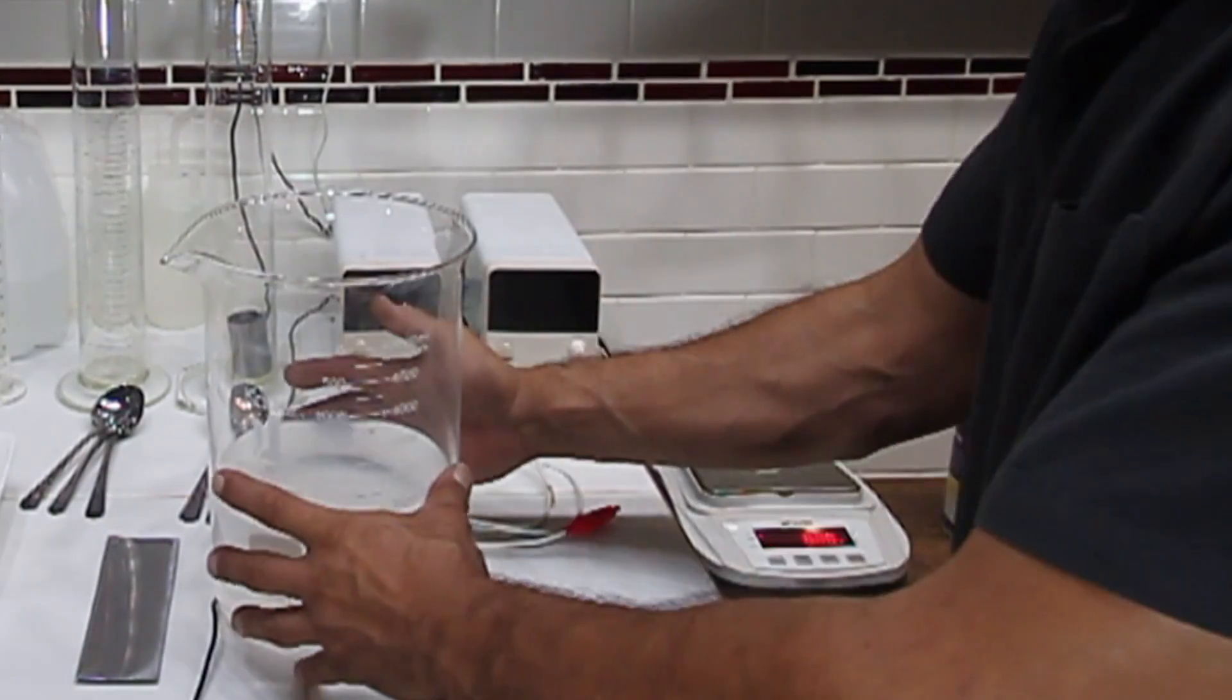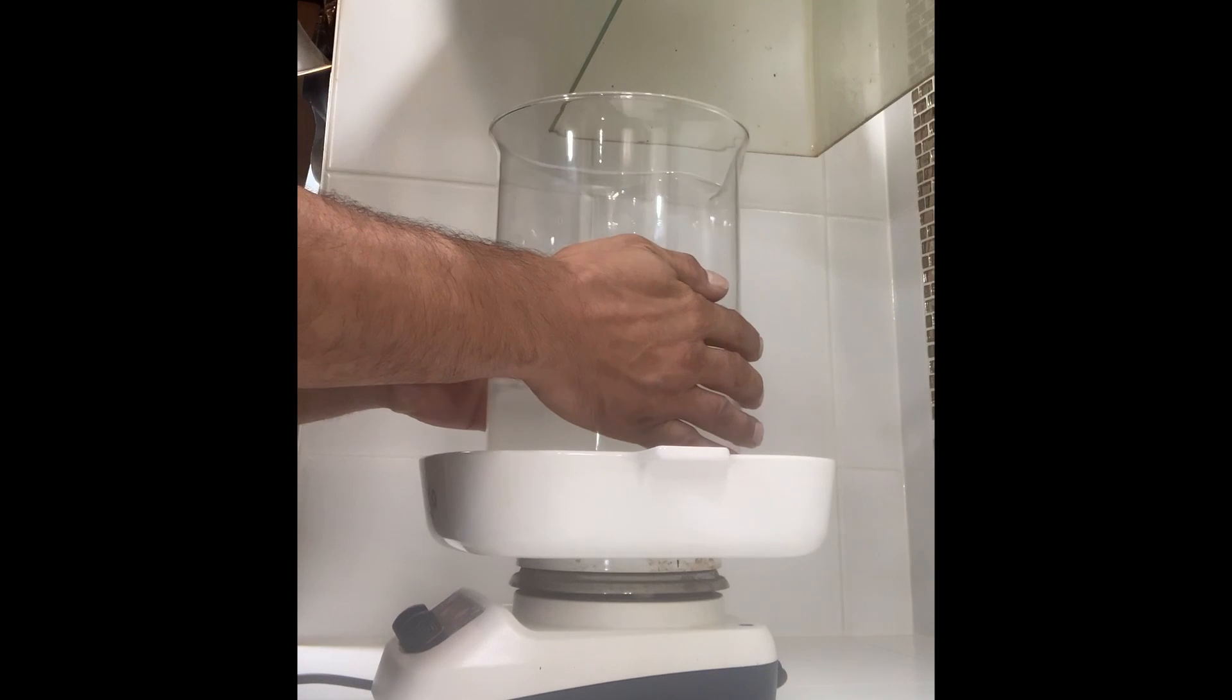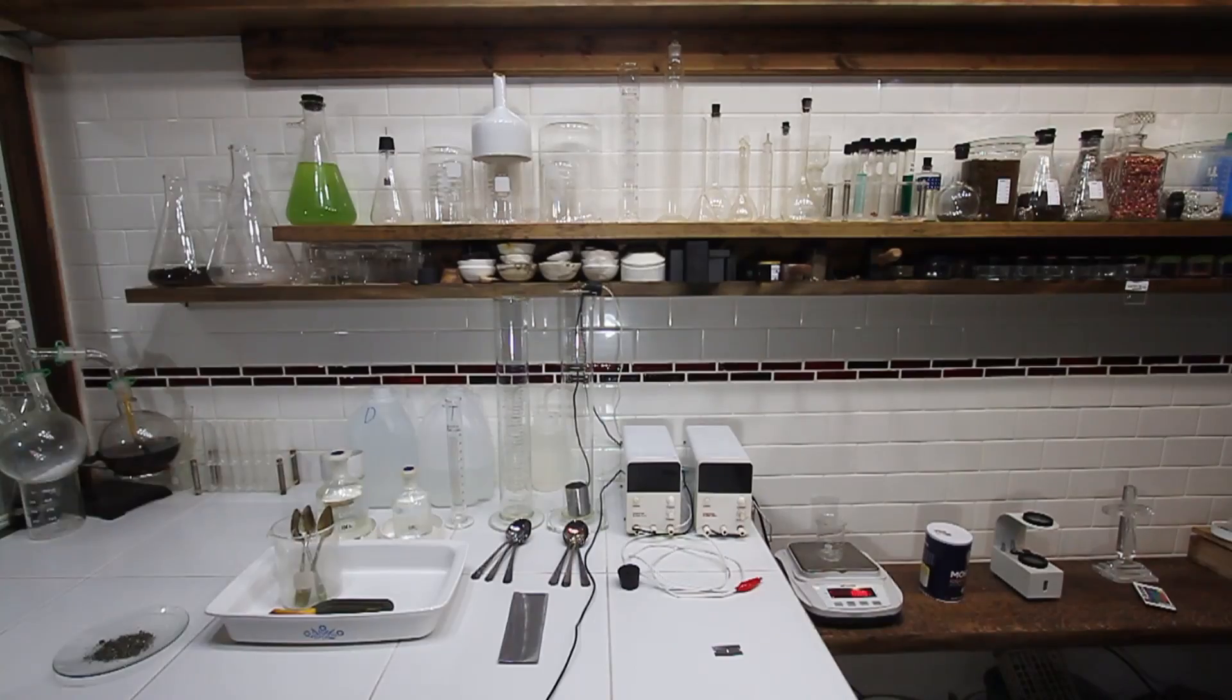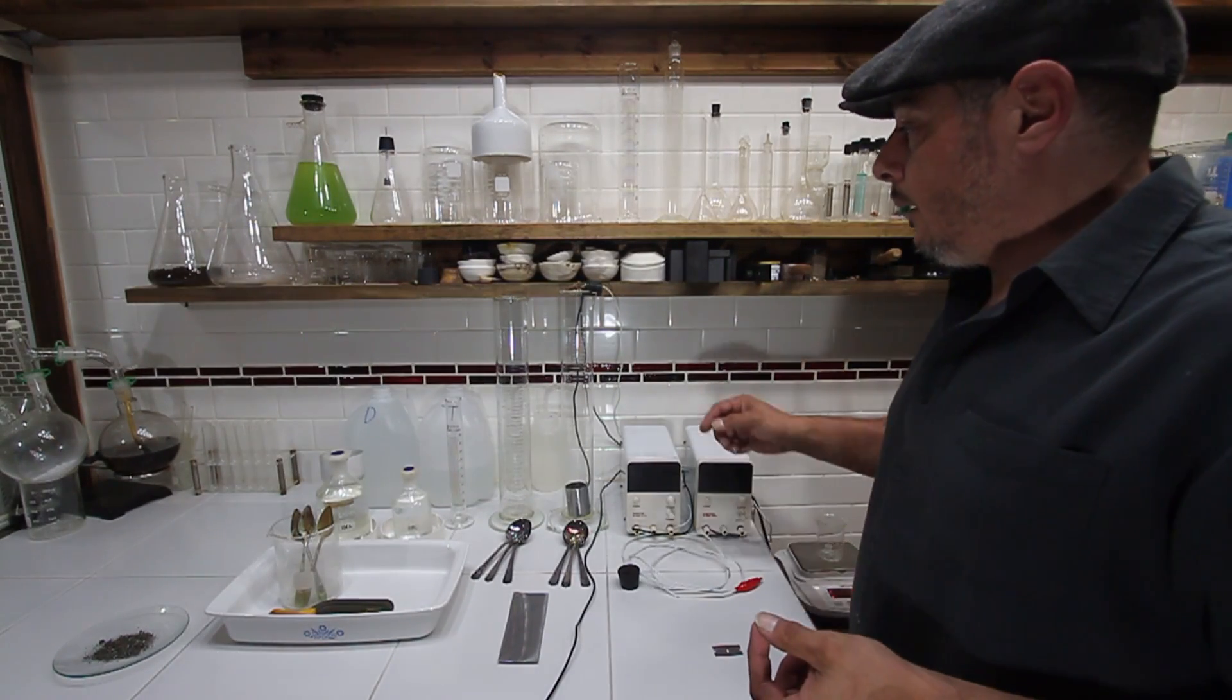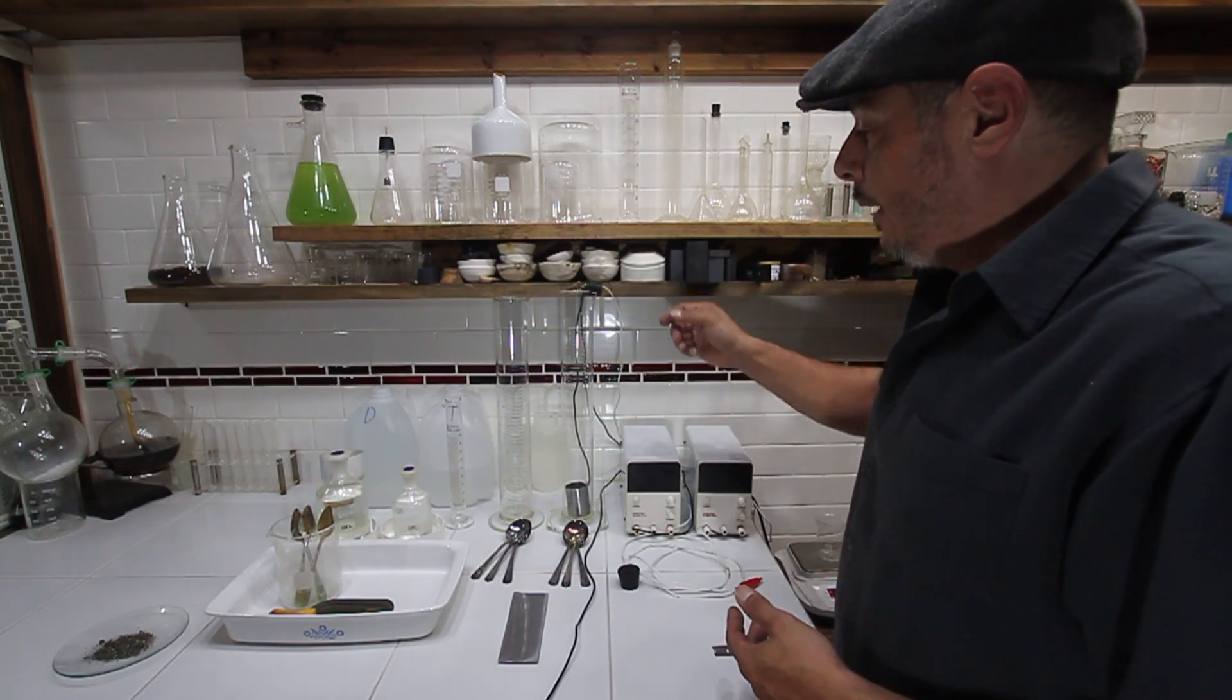We're going to take this over and heat this up, turn that to 280 degrees. Now while we're waiting for that to get up to temperature, I'll bring it just about to a boil and then let it cool down.